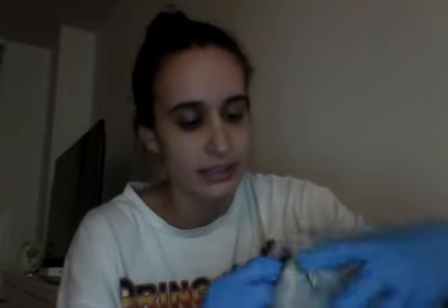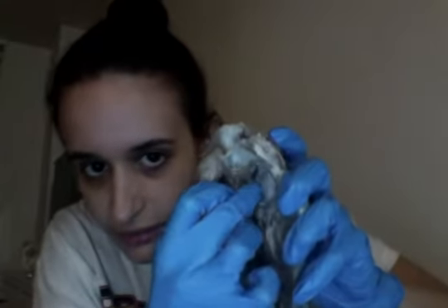Once inside, we have the left valve, which is the mitral valve, and that is on the left side right over here. And that brings rich oxygen blood flowing from the left atrium to the left ventricle. So left atrium to the left ventricle, and that is the mitral valve.